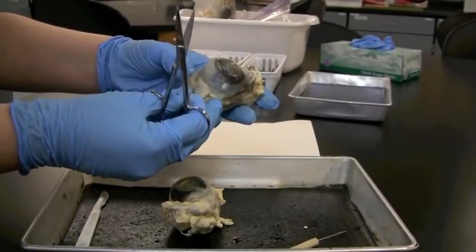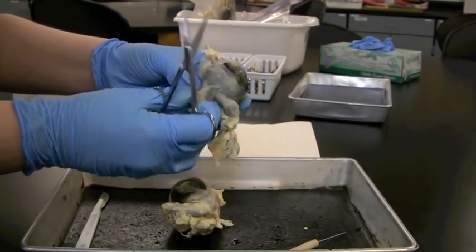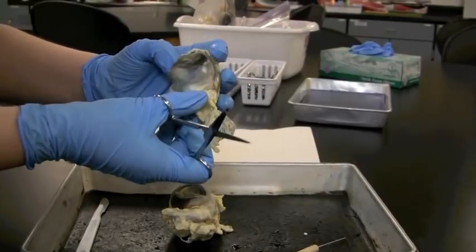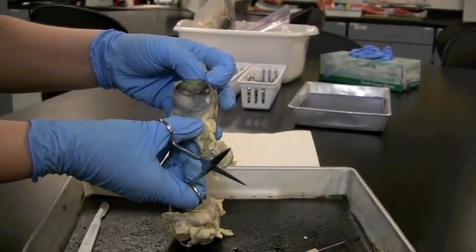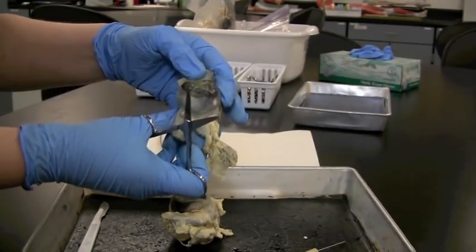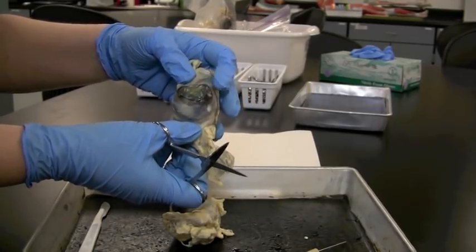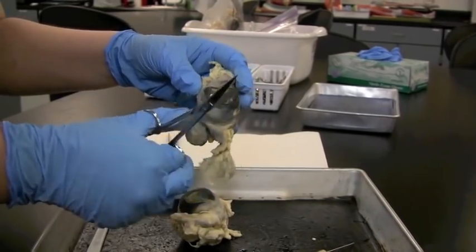There's muscles. If we took the time, we could distinguish the different extrinsic muscles: the lateral, medial, superior and inferior rectus muscles that are straight, the oblique muscles, inferior and superior. We would be able to get through all of those.